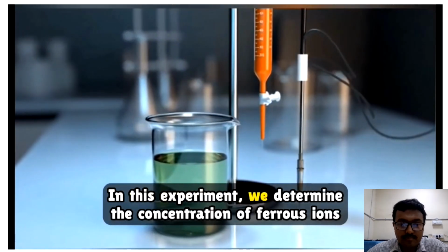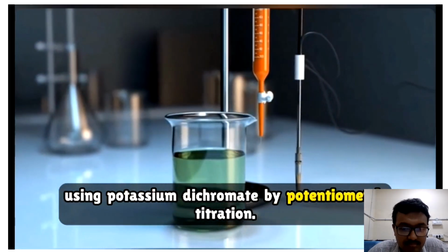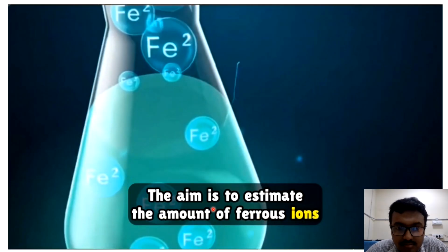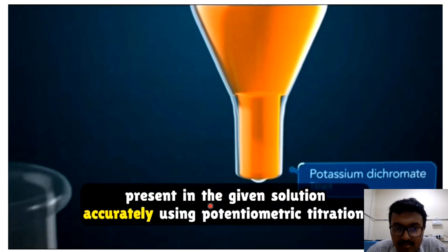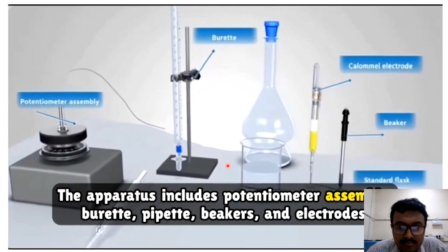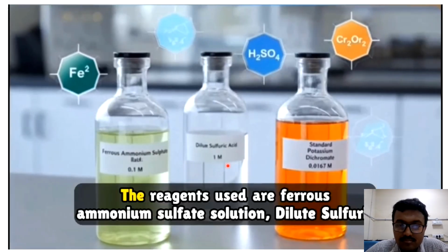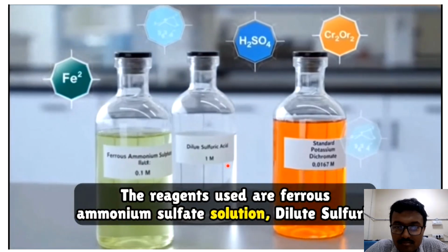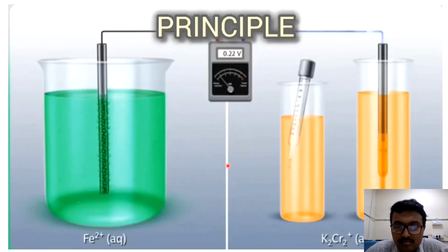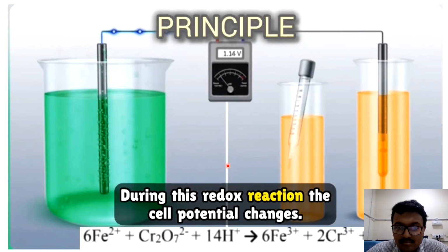In this experiment, we determine the concentration of ferrous ions using potassium dichromate by potentiometric titration. The aim is to estimate the amount of ferrous ions present in the given solution accurately using potentiometric titration. Apparatus includes potentiometer assembly, burette, pipette, beakers, and electrodes. The reagents used are ferrous ammonium sulfate solution, dilute sulfuric acid, and standard potassium dichromate solution. Potassium dichromate oxidizes ferrous ions to ferric ions in acidic medium. During this redox reaction, the cell potential changes.